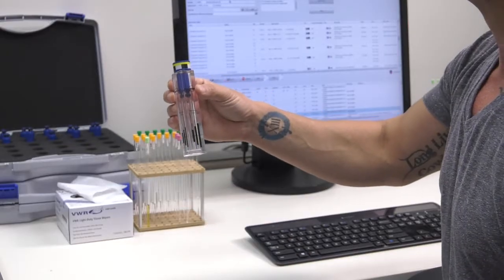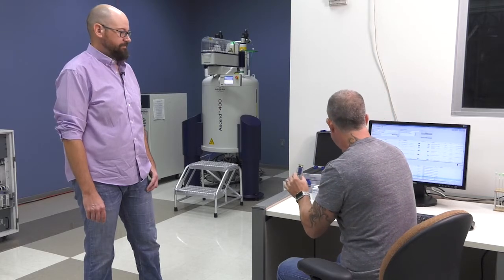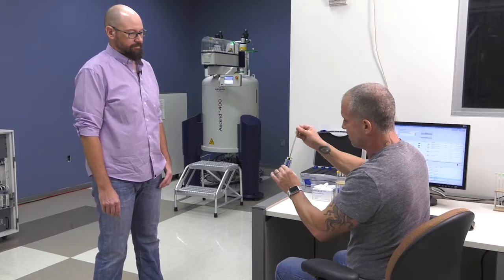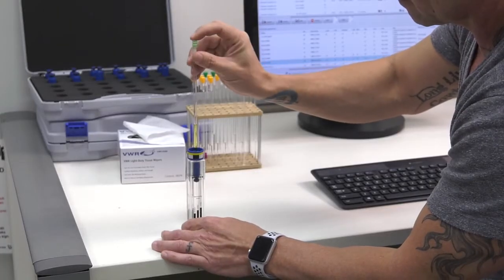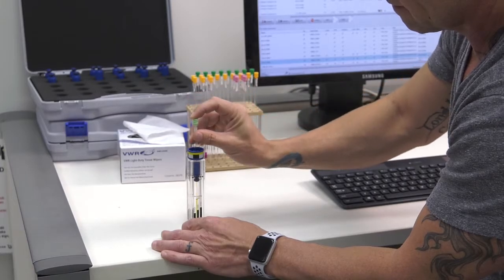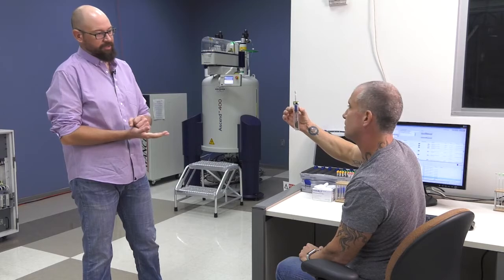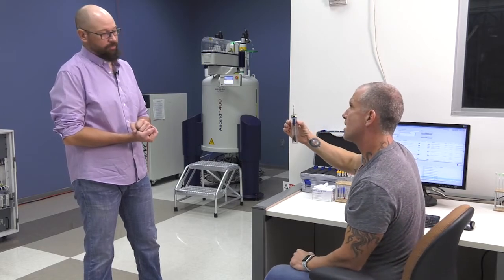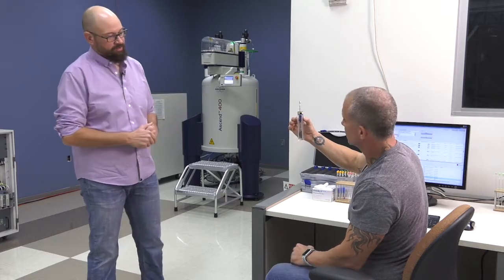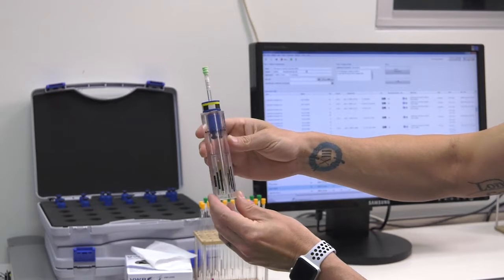So you have your turbine put in there, and then we take our sample here and put it into this, like that. And what you're looking for is that it is touching the bottom, because the probe that we're going to set this into is not hollow. So it has a finite depth that it can go to, otherwise you'll damage the instrument or break your sample. The next thing you're looking for is where that black indicator marks, if you rotate a little bit, is the actual NMR coil that you're trying to center this around.